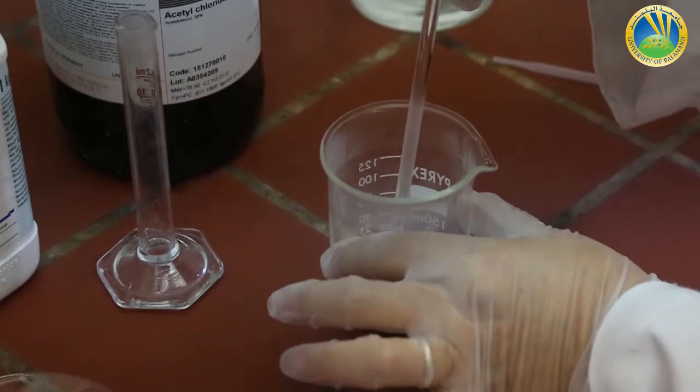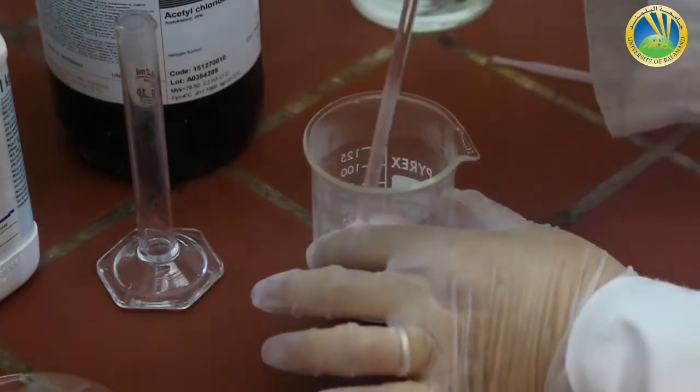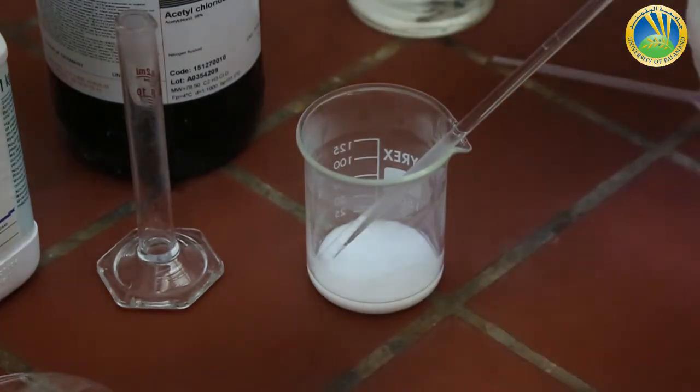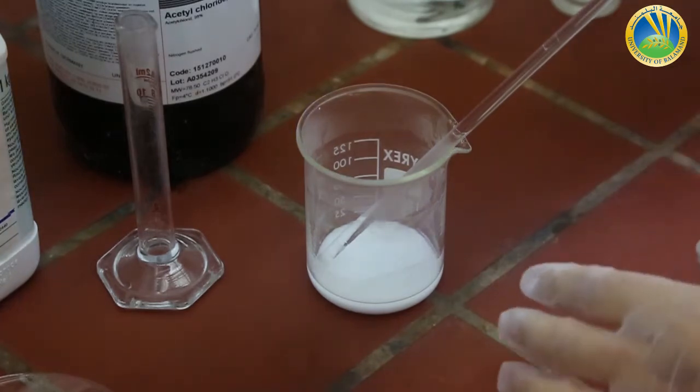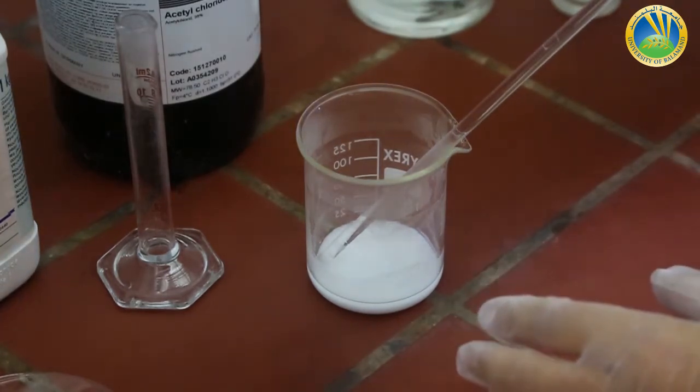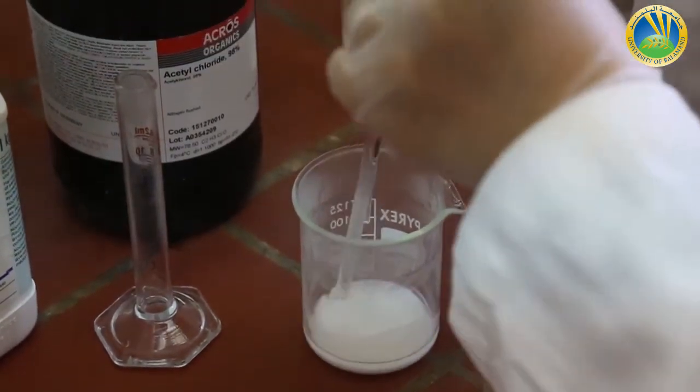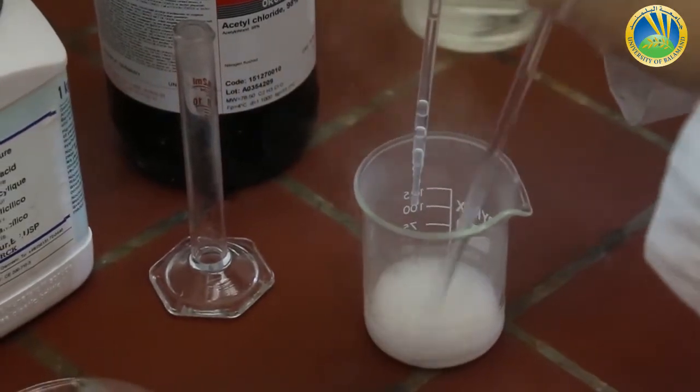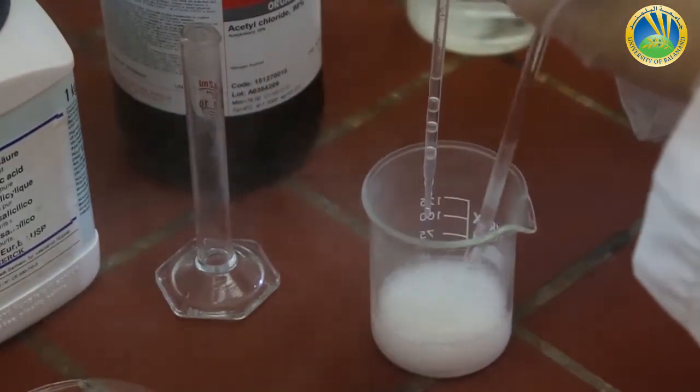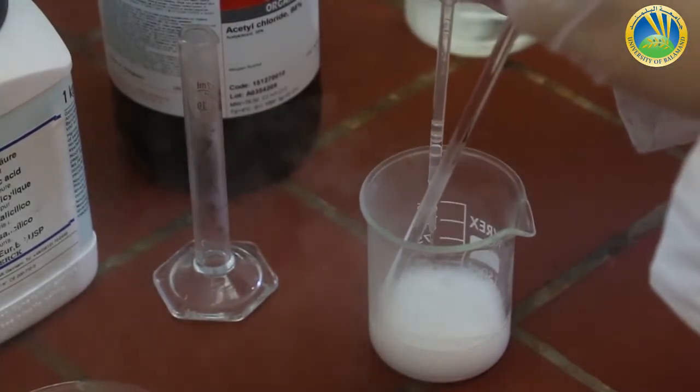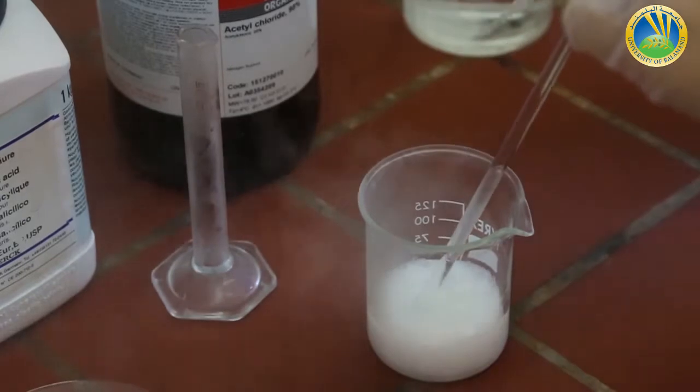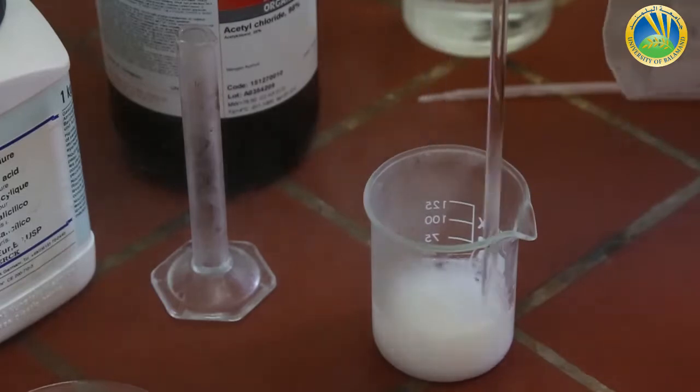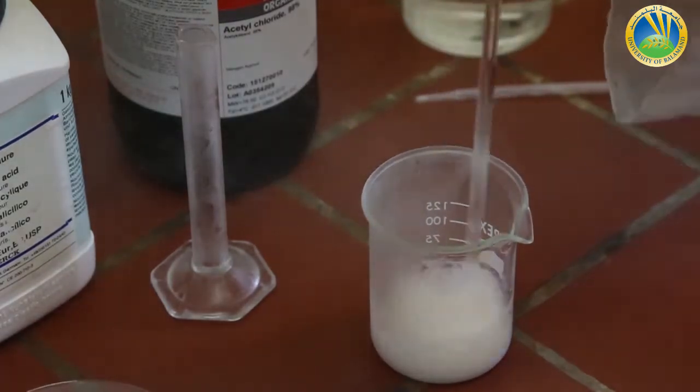I have to stir well and now I have to add a few drops of H2SO4 concentrated acid. Do you see the fumes? Do you see this reaction? That's why I have certainly to work under the hood. The reaction is very vigorous.